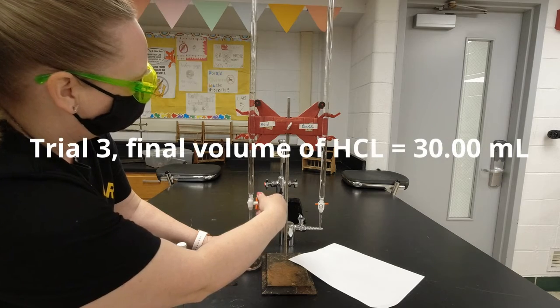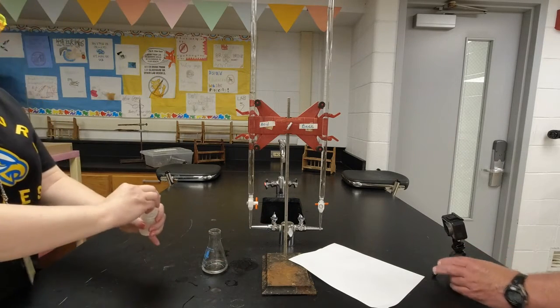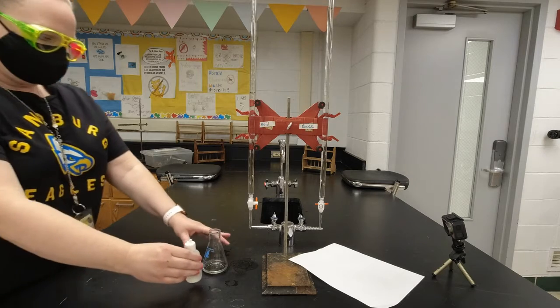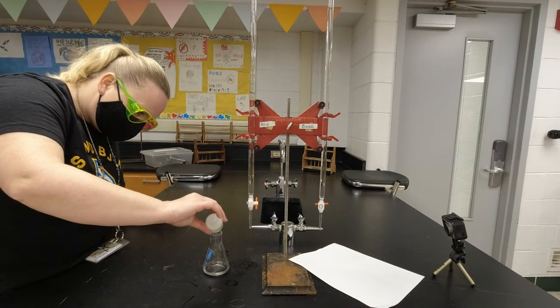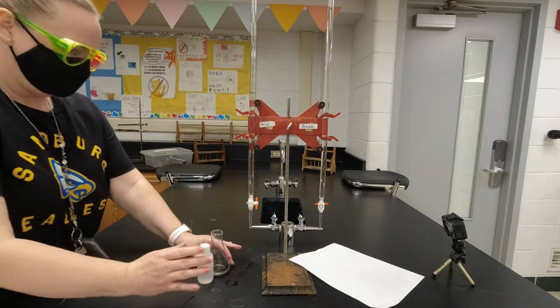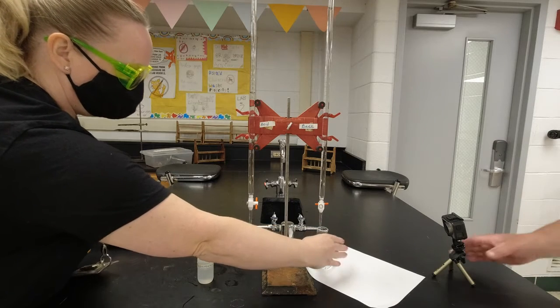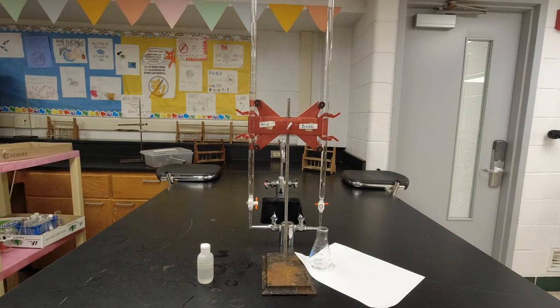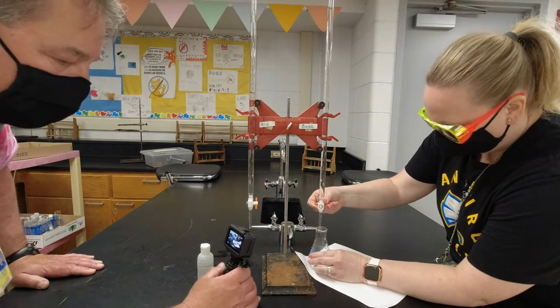Okay. All right, that looks like it. So right on 30. So I'm going to write that down. Okay, she's going to add 1 or 2, 3 drops of phenolphthalein. All right. 1, 2. I'll do 3 too. And then she's going to come over here to this side. And just like we did before, she's going to add drop by drop.